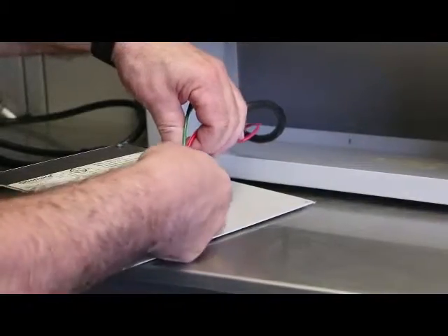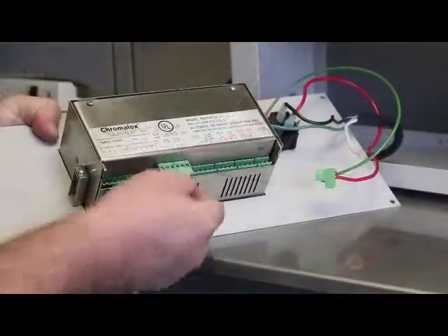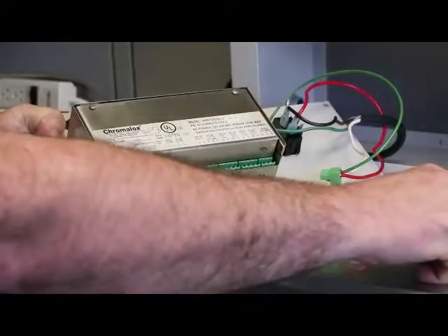Remove the electrical connection plug from the back of the old controller. Remove the thermocouple connections.